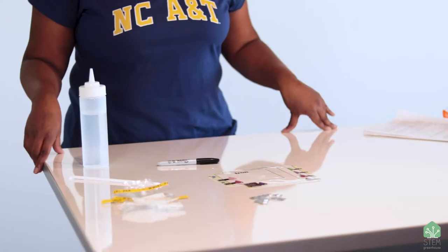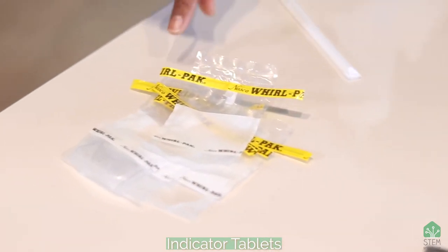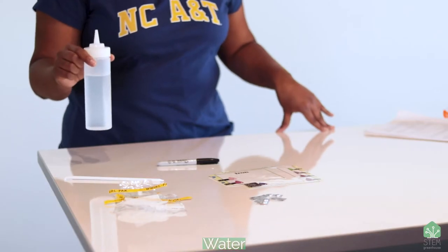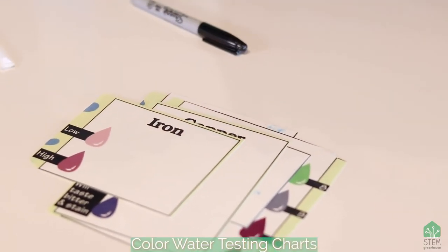Today we're going to be testing the quality of our drinking water. We're going to use water from the tap to begin with. Tap water is just water that you get from your sink. These are the supplies that you'll need: indicator tablets for the various chemicals, water testing bags, a straw, some water from the tap, a marker, and the water color testing charts.